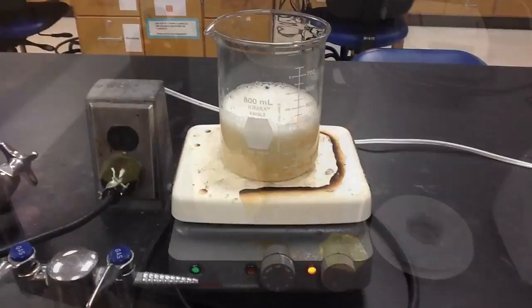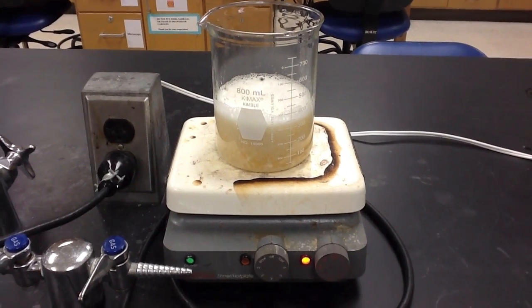Once all of these components were mixed together, we were then prepared to boil the mixture for five minutes.